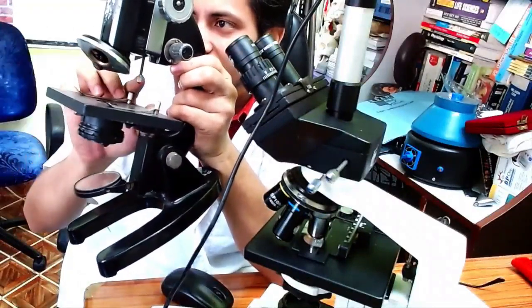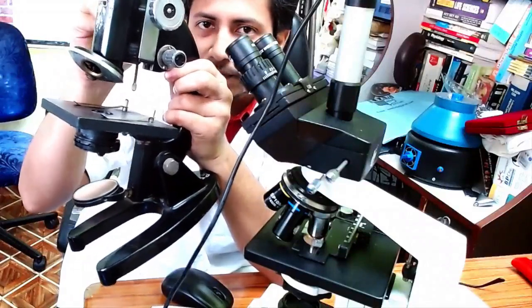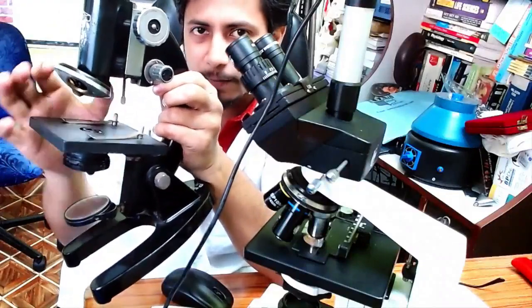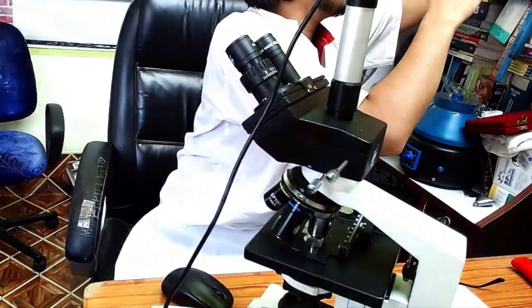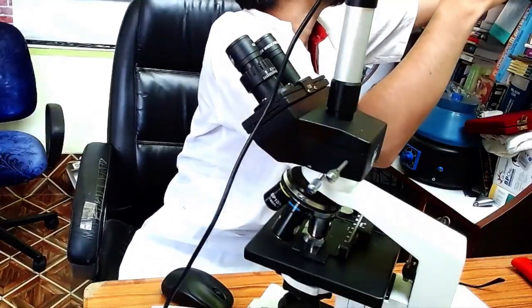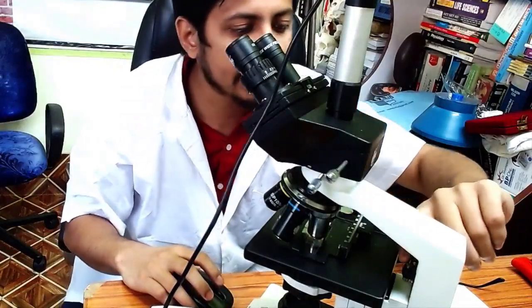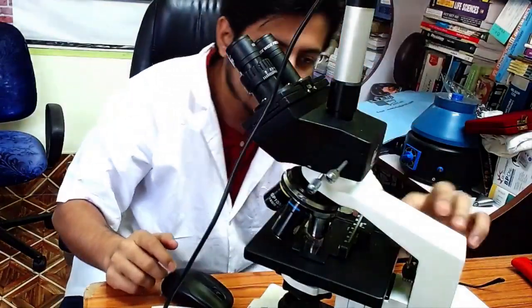You can also see a screw present here. This screw is designed to prevent loss of the specimen slide and damage to the objective lens. The tighter this screw, the less the objective lens can come down. This same protective screw is also present in binocular microscopes, where we can tighten or loosen it to limit how far the stage travels and protect the slide.